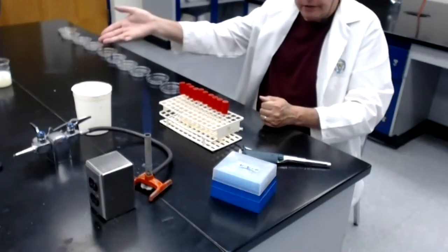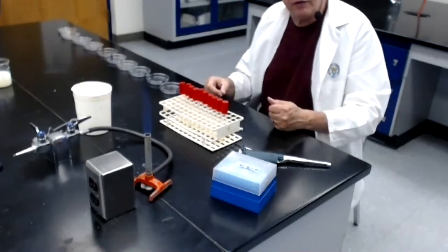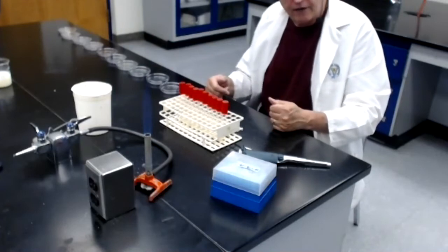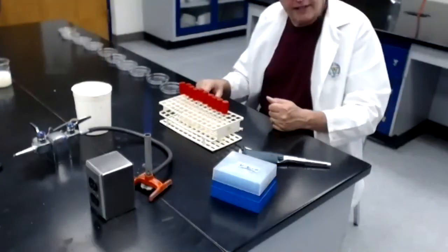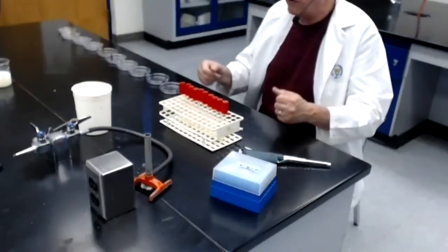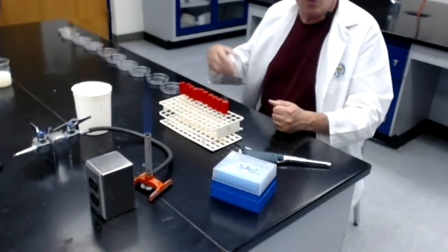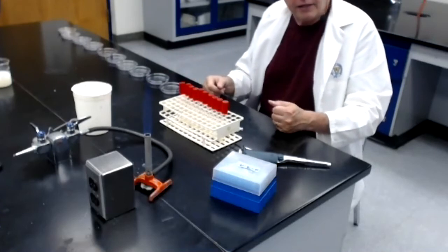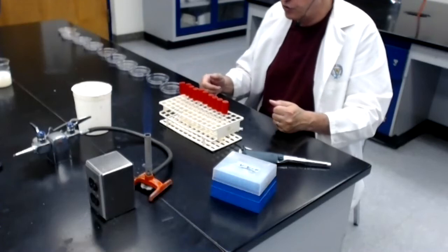It could be 20 mils. In fact, when I do this on my own, working in the lab, doing projects, I typically use between 15 and 20 mils of melted agar. I like having a little bit more. That way the agar doesn't dry out as quickly in the incubator. But we have found that 10 mils is usually enough. And so rather than waste materials, we have chosen to use the minimum that we need to use, which in this case happens to be 10 mils of melted tryptic soy agar.